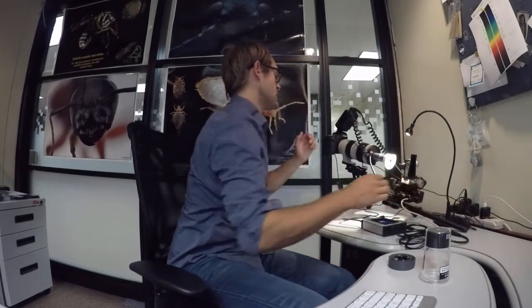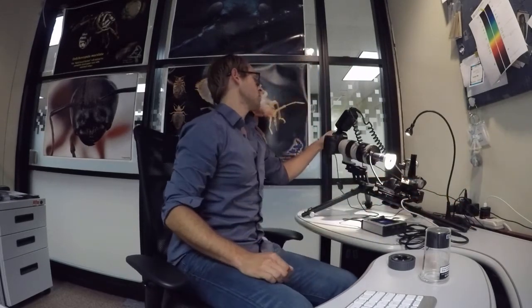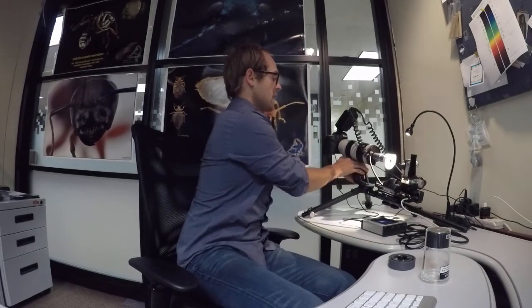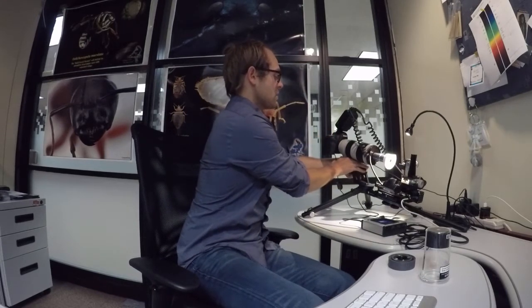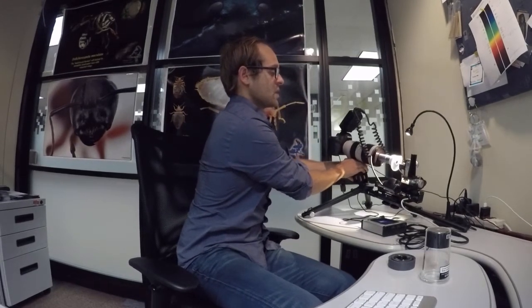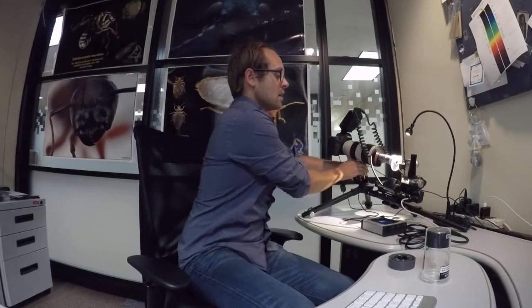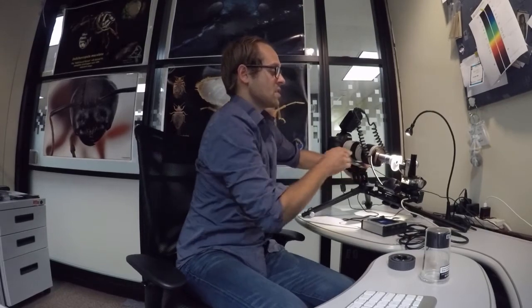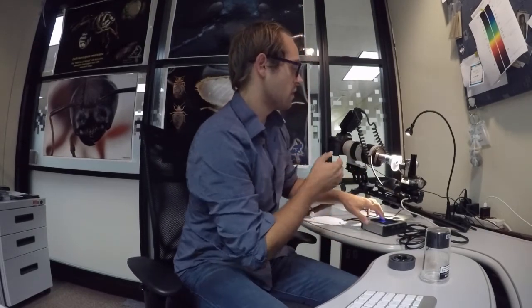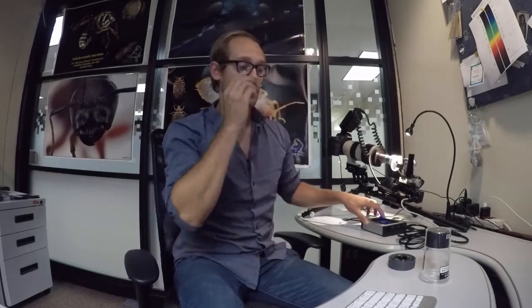We'll turn the light on, turn the camera on, we're just going to move the camera back into its original position, so we'll just slide it forward slightly. The stage is in a good position at the moment, we'll just slide it forward just a tad, so we get a little bit closer to that objective.